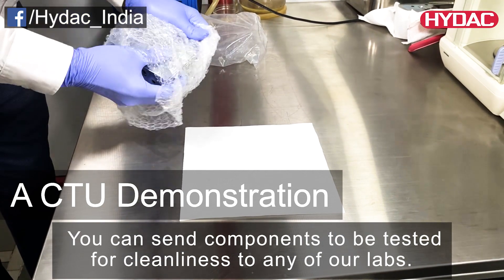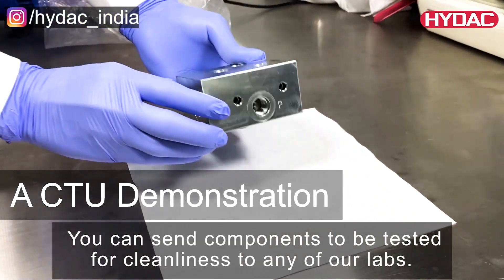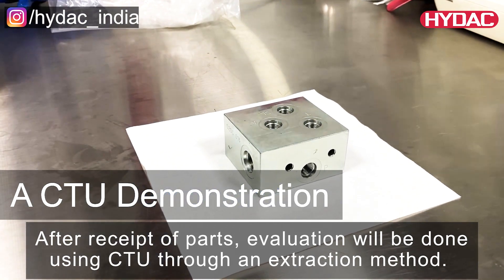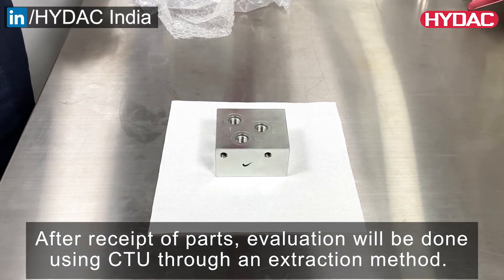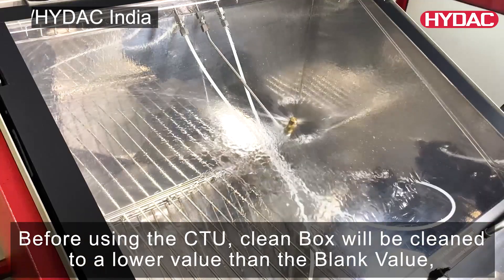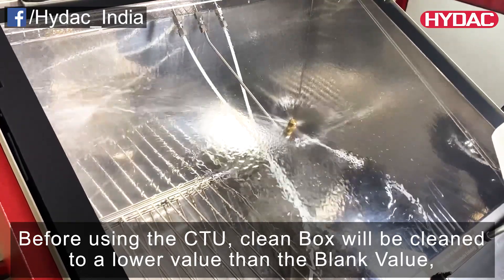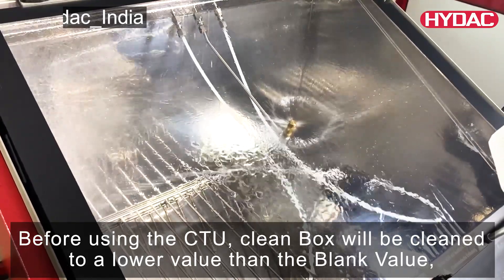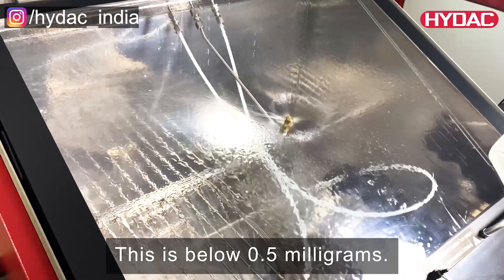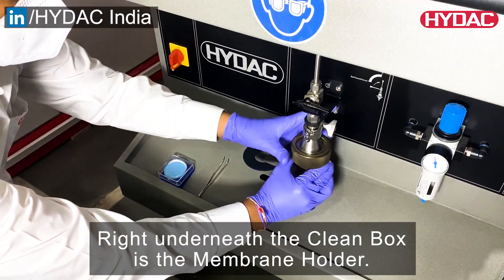You can send the components to be tested for cleanliness to any of our labs. After receiving the particular parts, evaluation can be done using the CTU through an extraction method. Before using the CTU, a clean box will be cleaned to a lower value than a blank value — this is below 0.5 mg. Right underneath the clean box is the membrane holder.